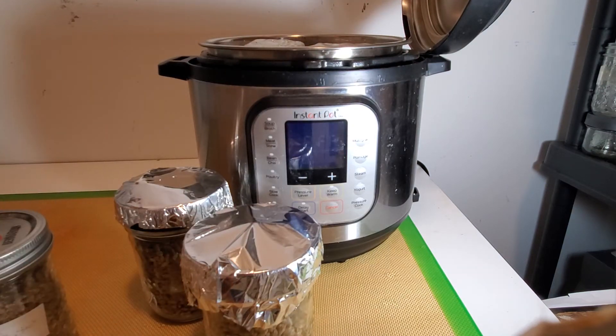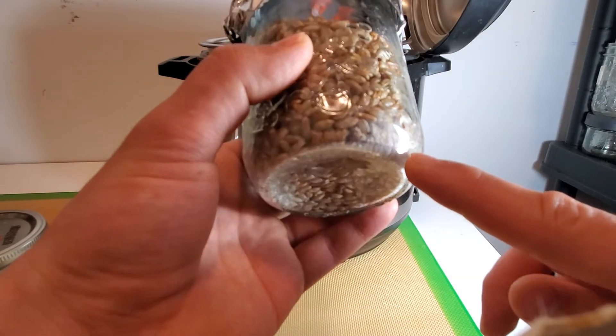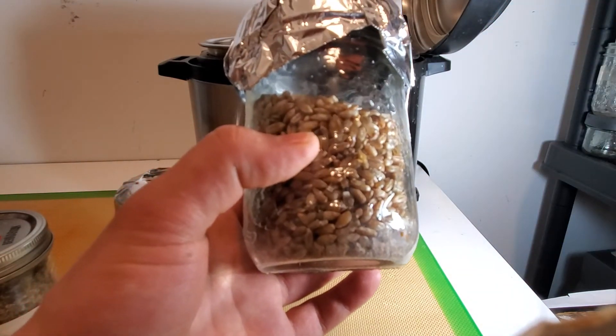What I've done is I've hydrated my rye overnight, then cooked it on the stove, drained it and let it dry. Then I've gotten my mason jars, put a couple fuel pellets in here, and lightly hydrated them — this way when I inoculate with liquid culture it will absorb any extra moisture in the jar.